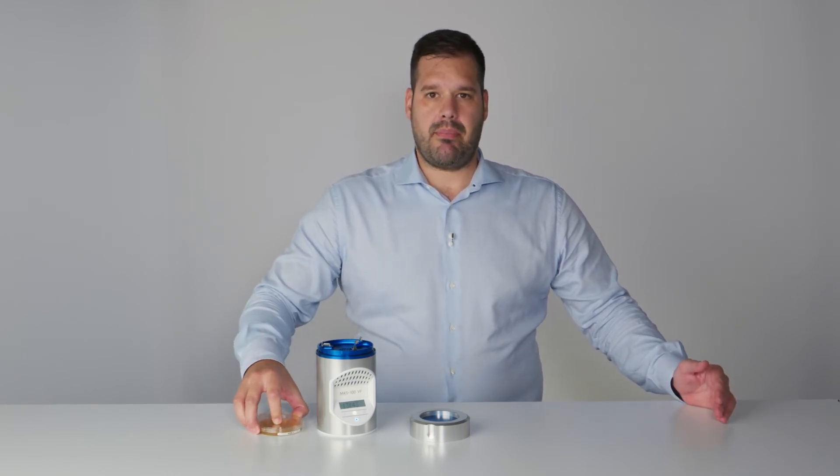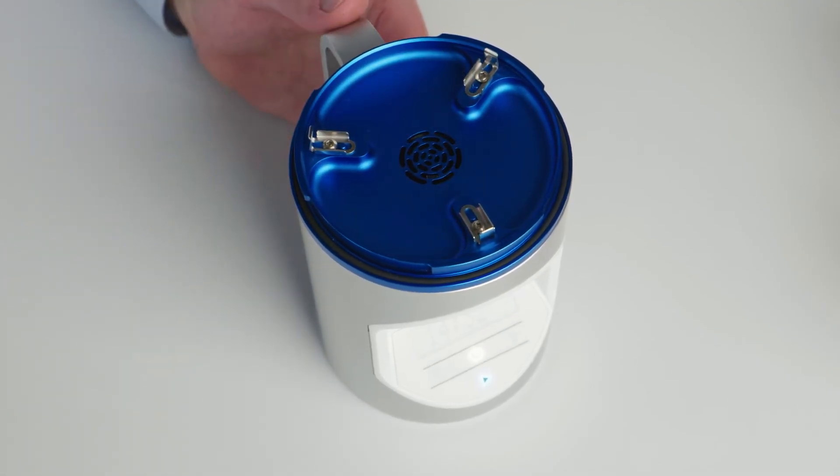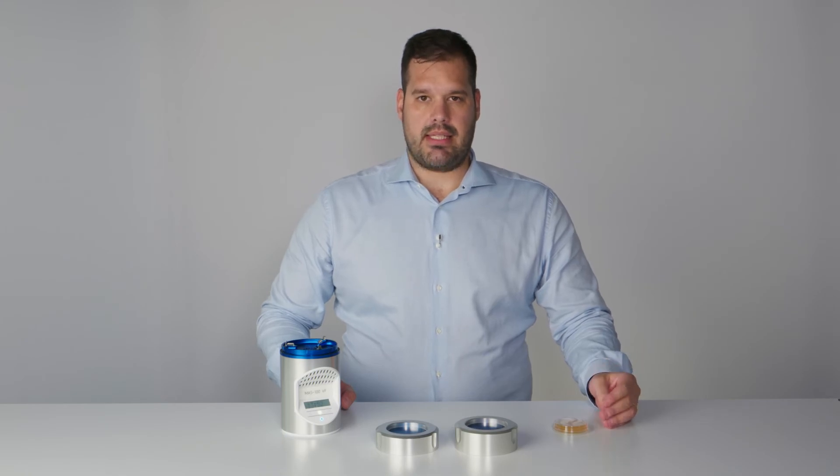MBV products are usable with consumables from many suppliers. Out of factory, the adapter and perforated lids are delivered for a standard 90 mm Petri dish, with clamps oriented outwards to hold 90 mm plates. If you are using contact plates, you need a special perforated lid because the agar diameter and height is different. If you want to use cassettes from the Growth Direct system, you need a dedicated perforated lid and also special clamps to hold the plate in place.